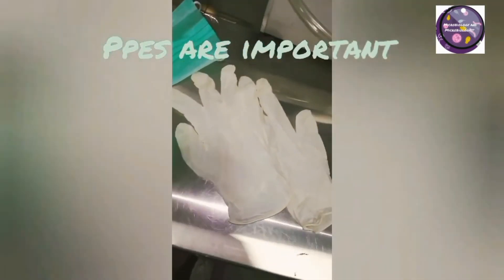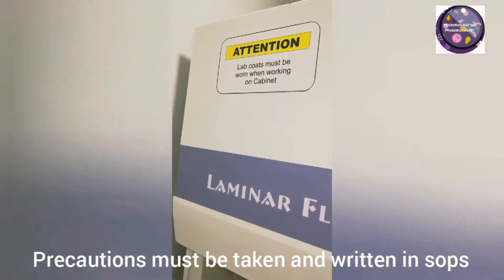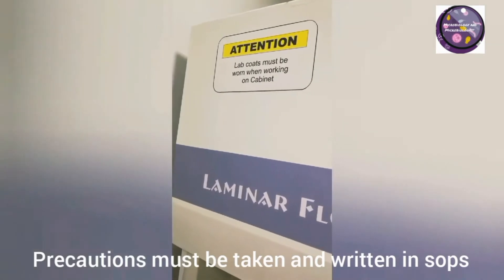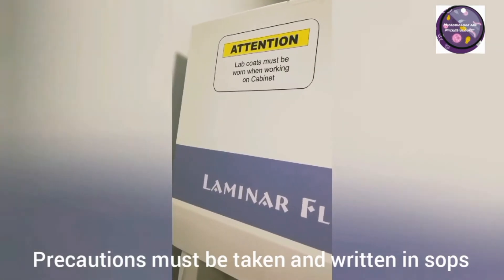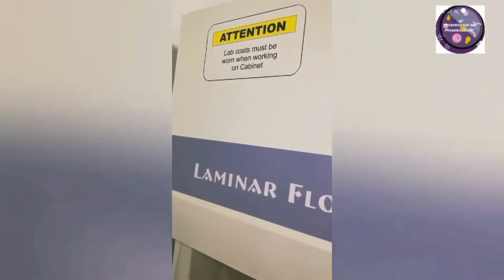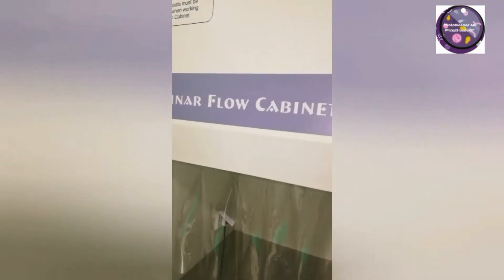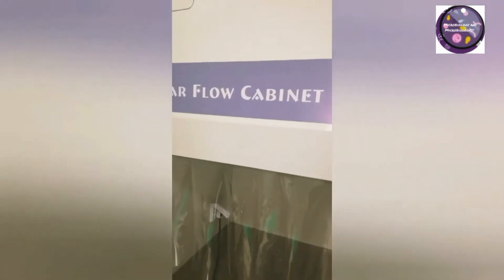As you can see, precautions are already written on this laminar airflow cabinet: lab coats must be worn when working on the cabinet. This will prevent unknown contamination.